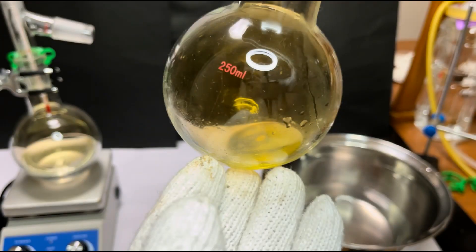I could collect 90% nitric acid, but the amount is really contrary to my expectation.